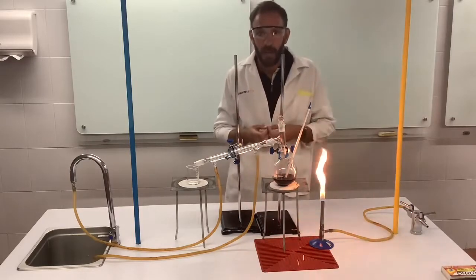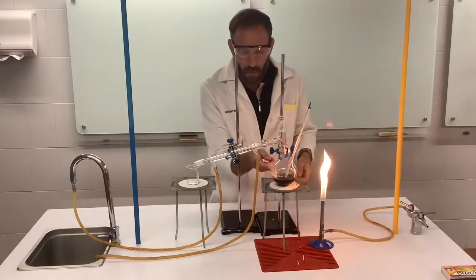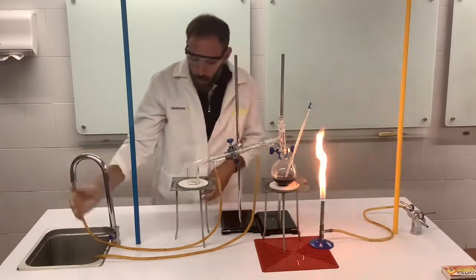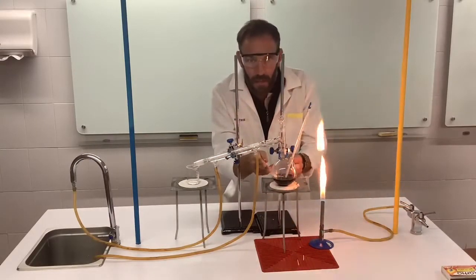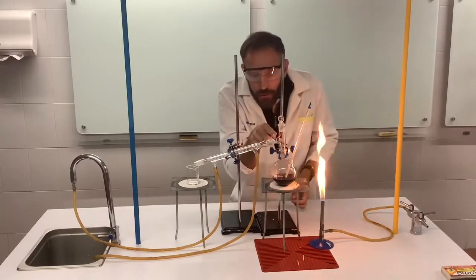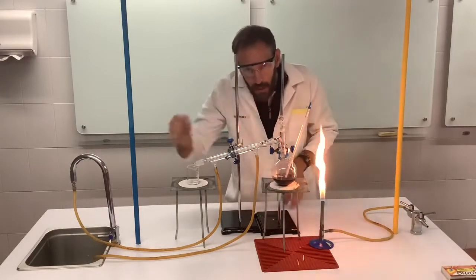Yeah? So here we have the distillation apparatus, and in this flask here we have the liquid or the mixture that we want to separate out. Here we have what is called the condenser. Now through this we run cold water. So cold water comes out here. We heat our liquid. One of the liquids that has a lower boiling point will evaporate off and turn to vapour or steam, and it will travel through here, and then the cold water running through it will condense it back into a liquid and we'll collect the liquid there.